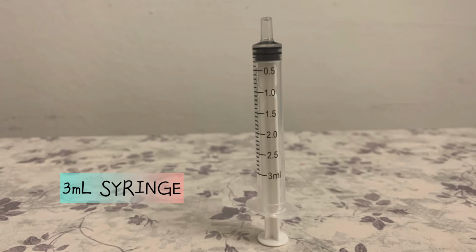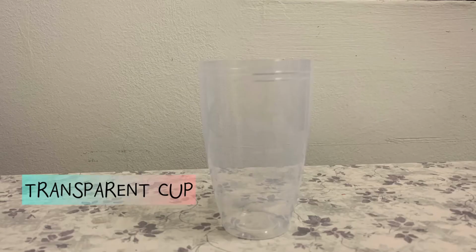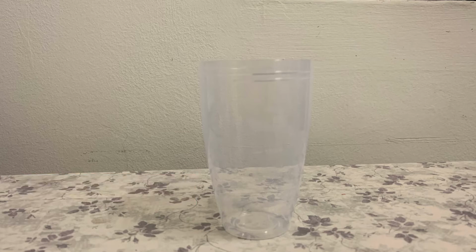A 3 ml syringe acts as a burette. A 10 ml syringe acts as a pipette to pipette the analyte. And lastly, a transparent cup to act as a conical flask.